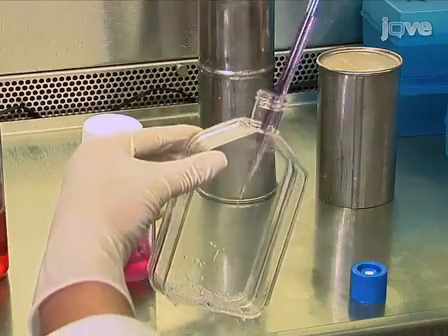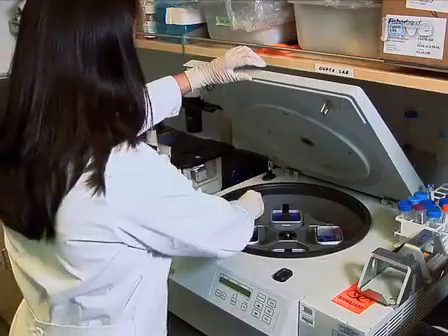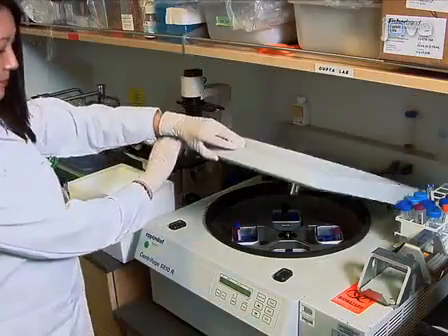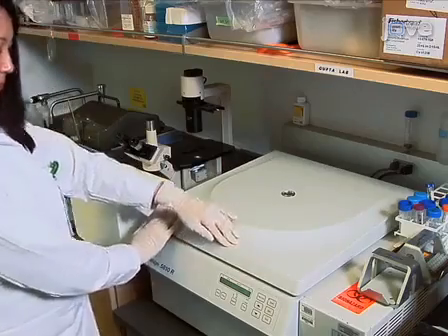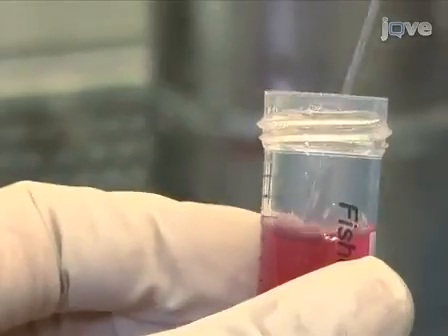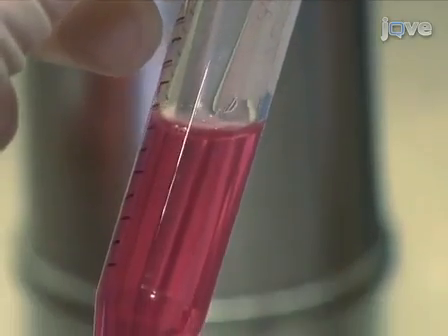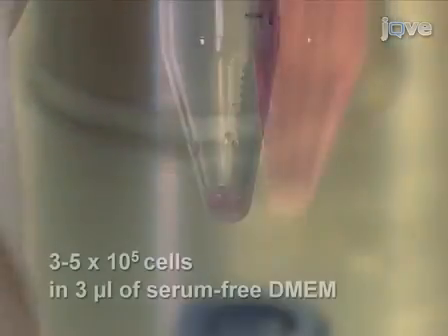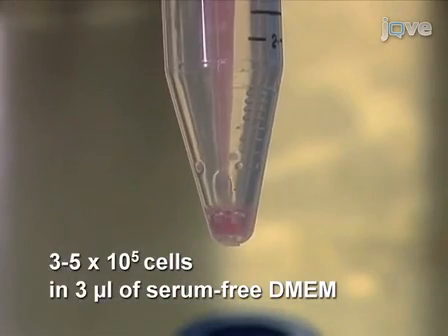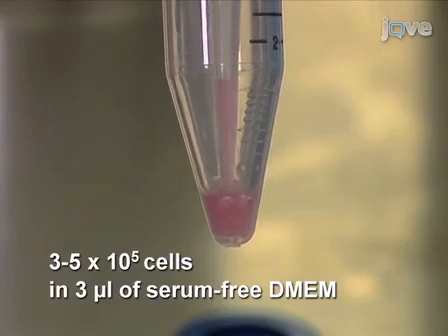As an alternative to the disaggregation of subcutaneous tumors, tumor cells can be harvested from cell cultures containing established brain tumor cell lines. Harvest the cells by trypsinization and centrifugation. Following the centrifugation, resuspend the cells in the appropriate volume of serum-free DMEM. For supratentorial injections by freehand, prepare 3 to 5 times 10 to the 5 cells in 3 microliters.